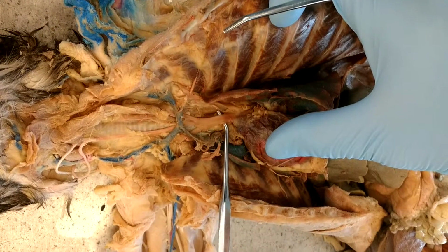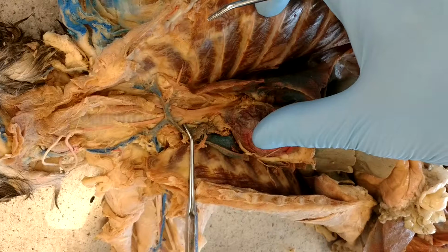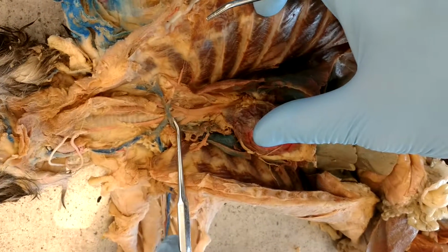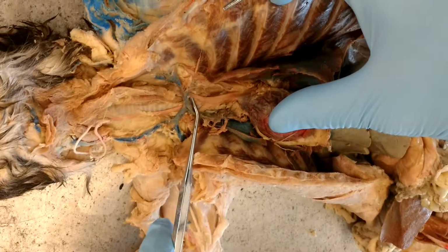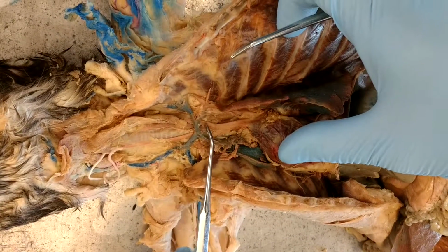The first branch is called the brachiocephalic trunk. And in the cat, it gives rise to the right subclavian artery right here, which goes out underneath the clavicle and into the arm. The right common carotid artery, like in the human, but also the left common carotid artery. Now in the human, the left common carotid artery is back off of the aorta. But in the cat, it comes off the brachiocephalic trunk.